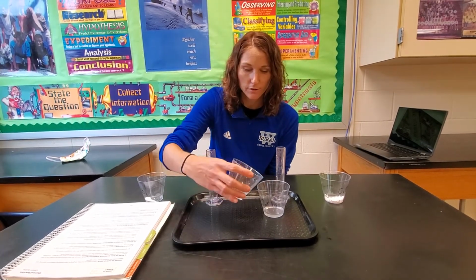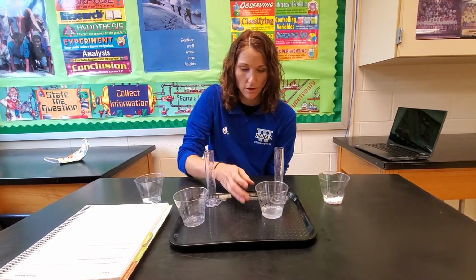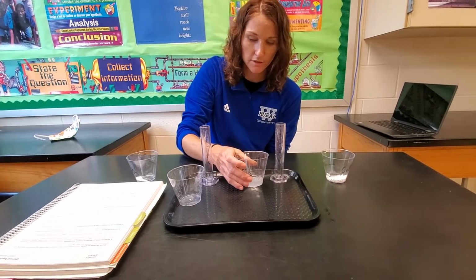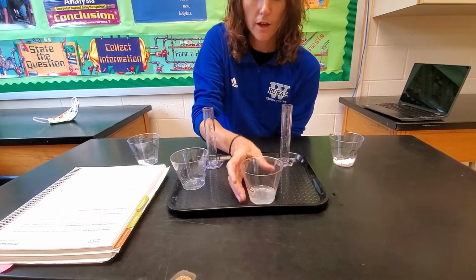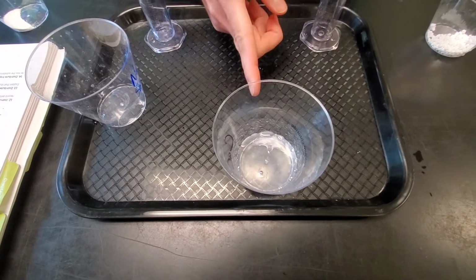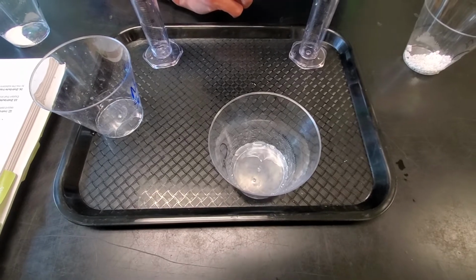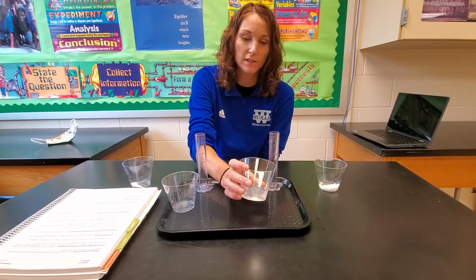What I'm now going to do is I'm now going to mix them together into the same cup, and I'm going to see what might take place. Okay? And I'm actually going to swirl it a little bit to cause the mix there. I don't know how well you could see, but it's cloudy now after I mix. So it went from clear solution to a cloudy mixed solution in the process. So something did change in this.